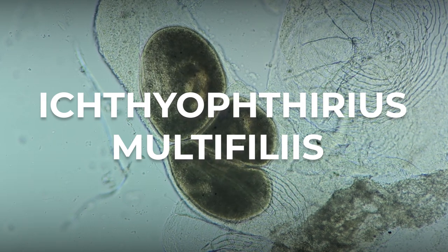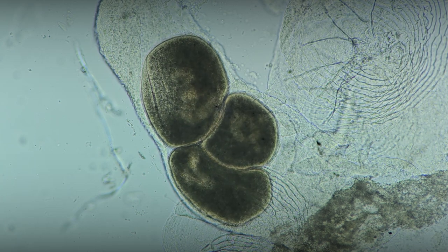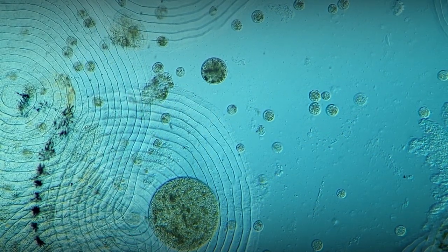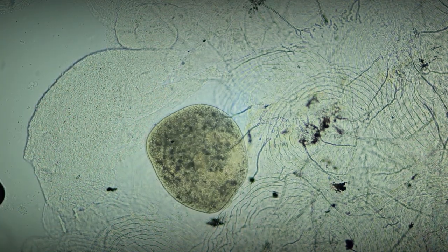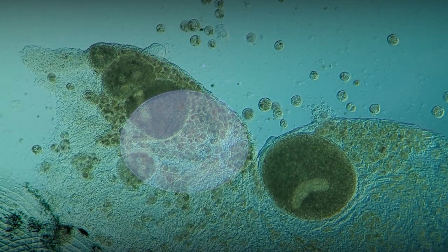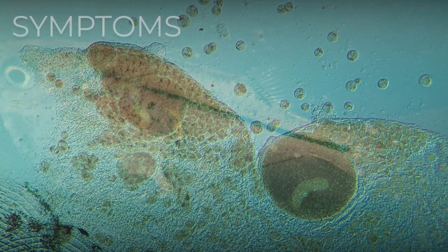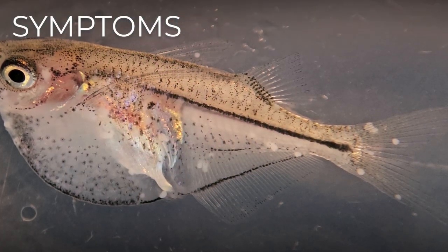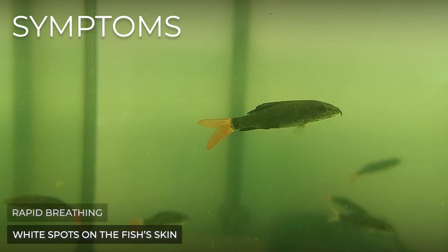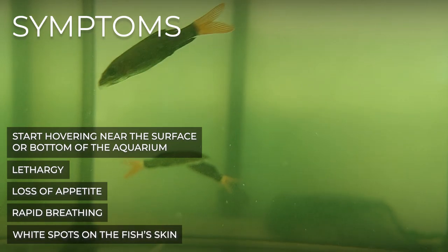Ichthyophthirius multifiliis, also known as Ich or white spot, is the only representative of the family Ichthyophthiriidae. Young Ichthyophthirius are small in comparison to the adults. Adults have a round flexible body shape, and sometimes a large half-moon-shaped nucleus is visible. Cells of different sizes and stages of maturity can usually be observed in scrapings. The main symptoms of an Ichthyophthirius infection are white spots on the fish's skin that look like small grains. Fish also experience rapid breathing, loss of appetite, and lethargy, and they start hovering near the surface or bottom of the aquarium.